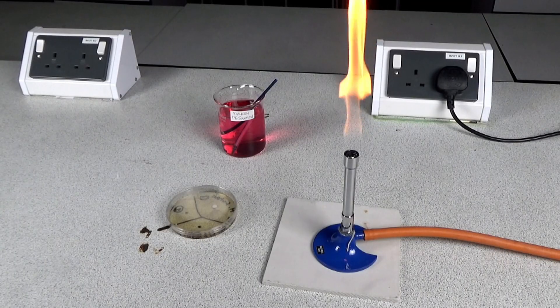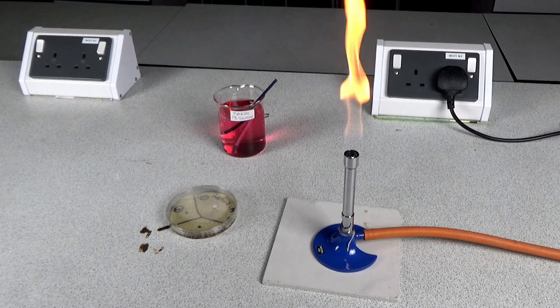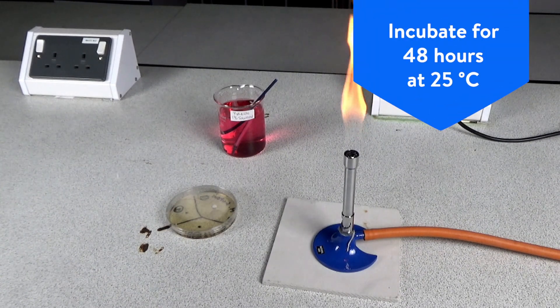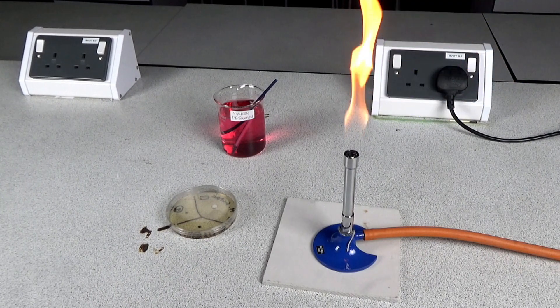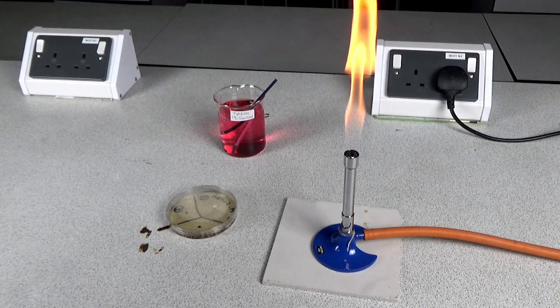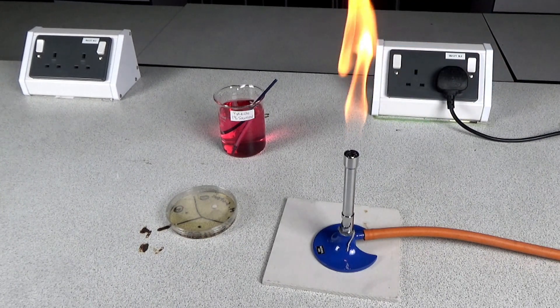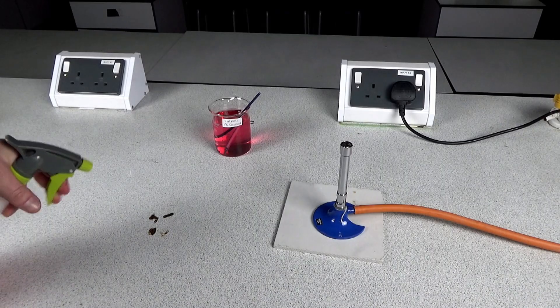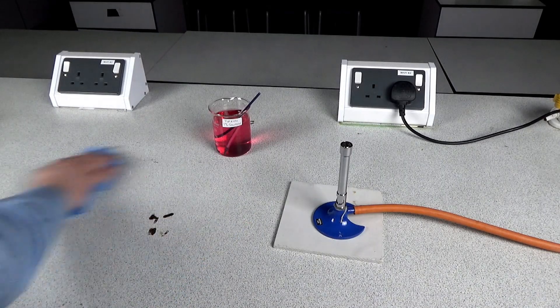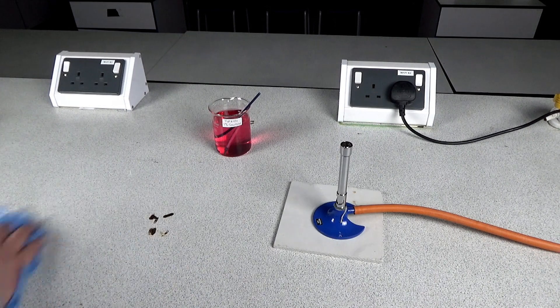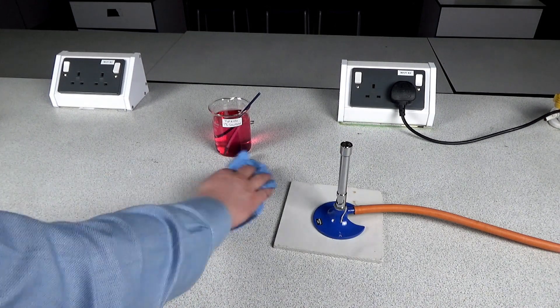The agar plates are then collected by the technician to incubate for 48 hours at 25 degrees C. We keep it below body temperature so we don't accidentally grow pathogenic bacteria. Your students can then clean down their working area and wash their hands thoroughly with hot water and antibacterial soap.